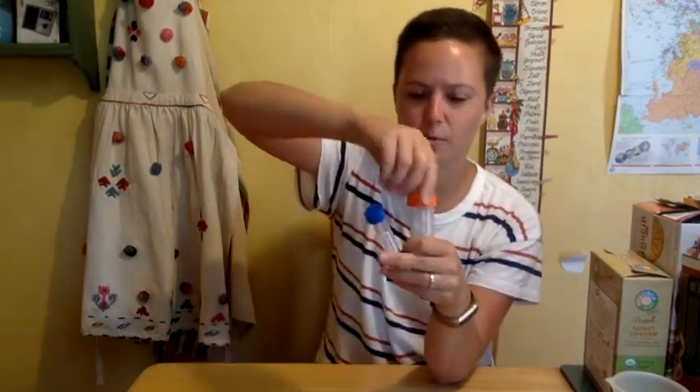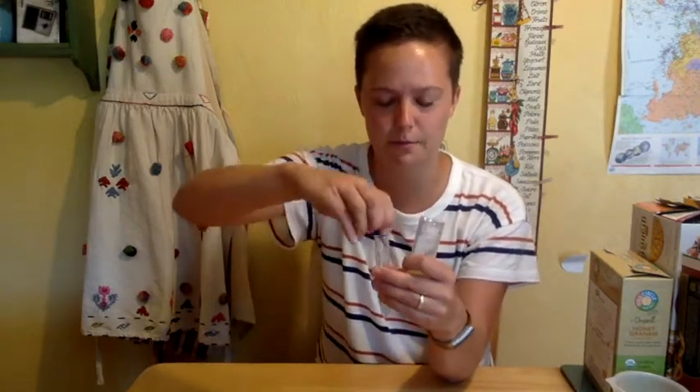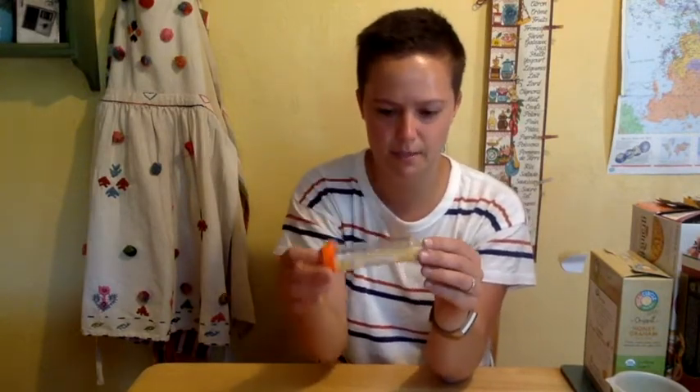After your 40 inversions, you're going to take your wheat germ and water and add your soap solution — add the whole thing. Now that it's got soap in it, you don't want to mix it too vigorously, so you don't want to form too many bubbles. But you do want to mix it gently for about a minute. Try to avoid bubbles as much as possible.